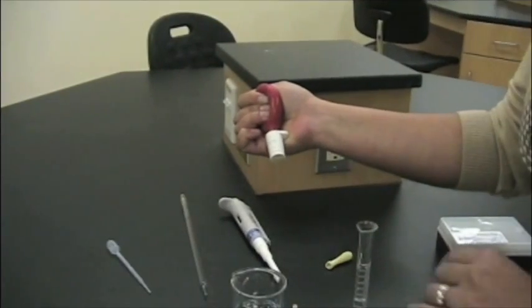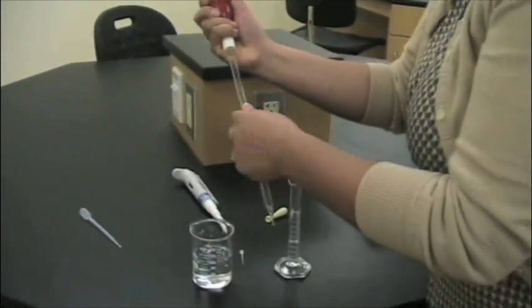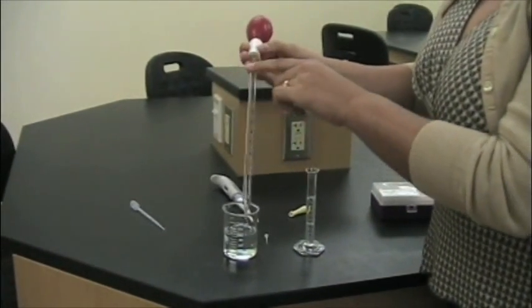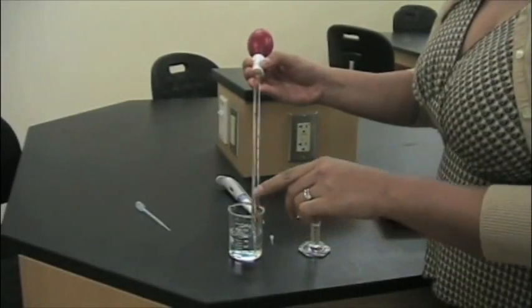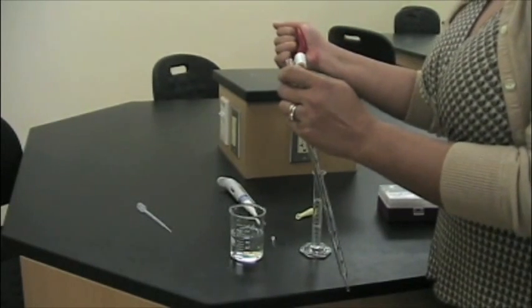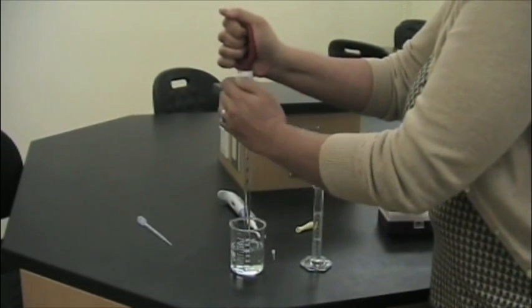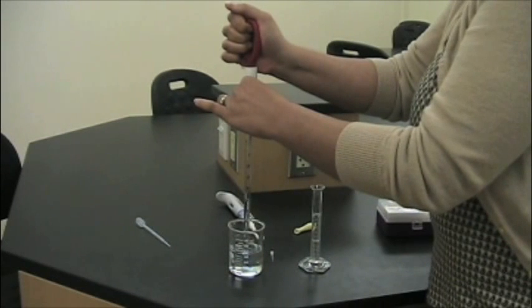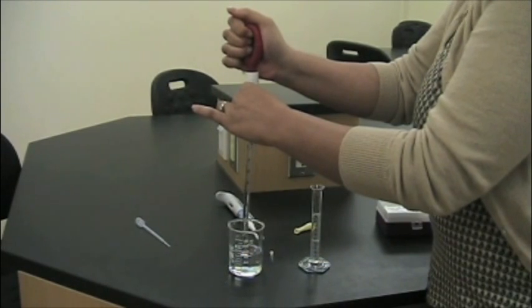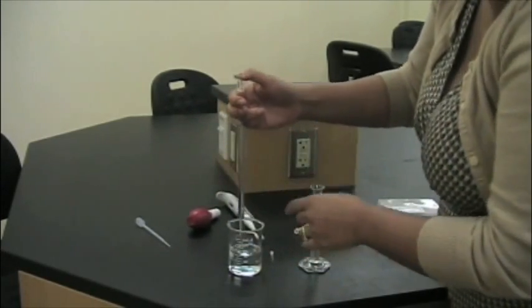We found a pipette bulb to be the solution. Here are the steps to using a pipette and a pipette bulb. Find a pipette bulb that fits the size of your pipette. Attach the bulb, ensuring that you are using the right sized pipette. Squeeze the bulb to remove any air that is in the bulb. Next, place the pipette in the liquid and draw up the volume that you need. Wait until you have drawn a volume larger than what you need. Remove the bulb and secure the volume in your pipette by placing your finger on top of the pipette.